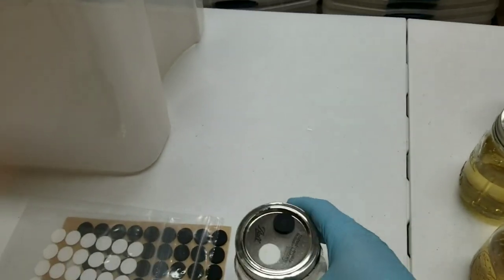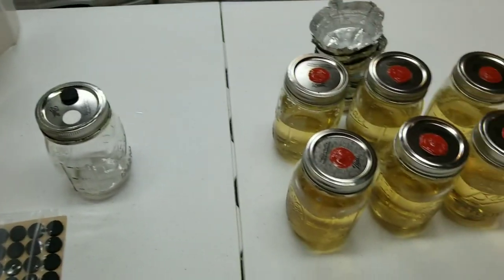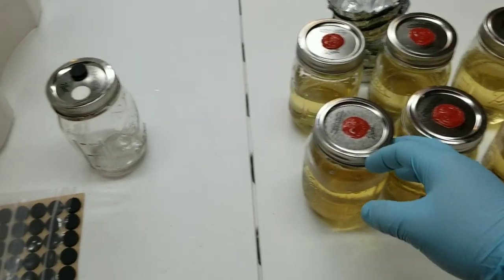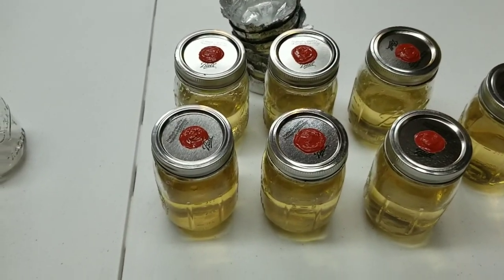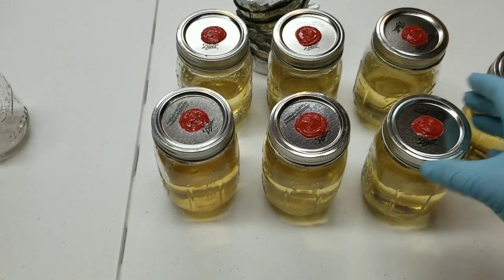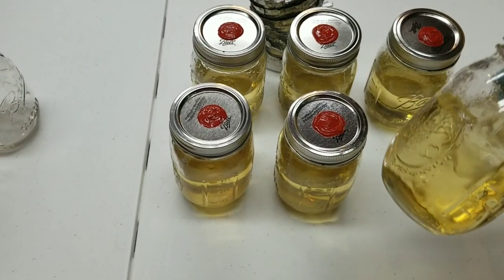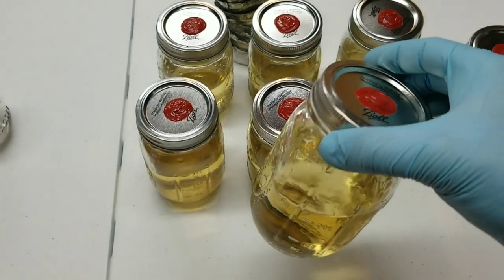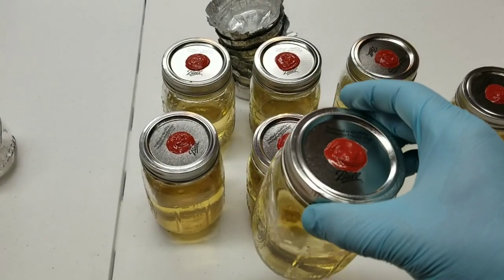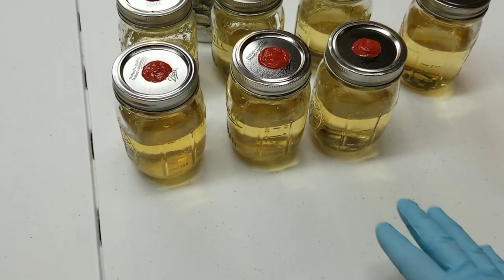If you're going to get really into this hobby you'll want to start maintaining some cultures yourself so you don't have to keep buying syringes — maintaining jars of each species or strain you're growing. If you're making jars you plan to have around for a year, you don't need super chunky mycelium, you just need enough to inoculate grain. I recommend going with a non-vented lid because they're just easier to work with — you can turn them right upside down and don't have to worry about a filter disc getting contaminated. With limited fresh air, your mycelium isn't going to go crazy and get super chunky.